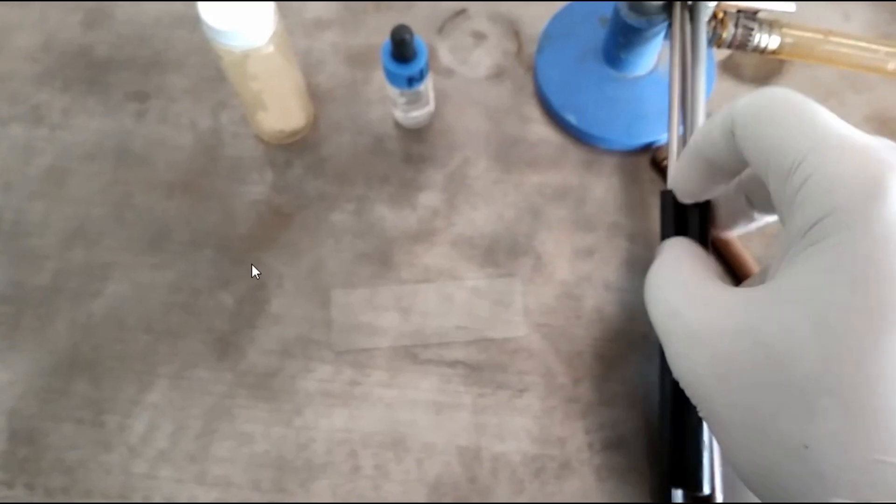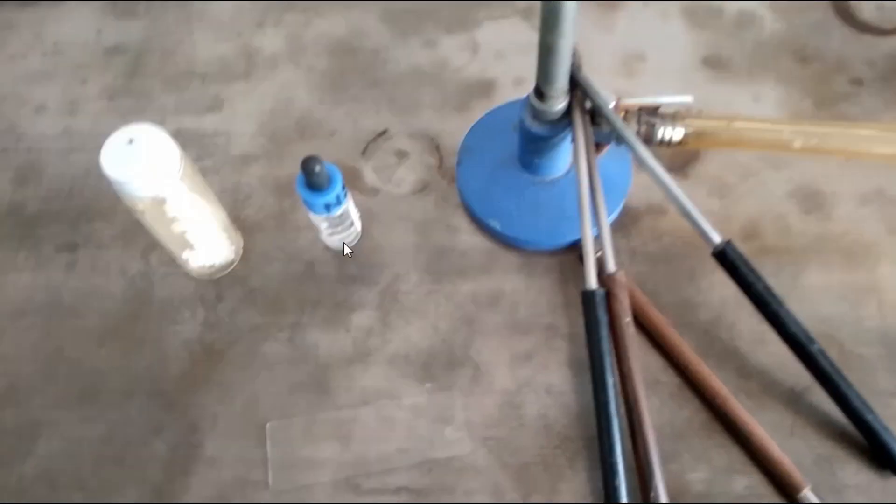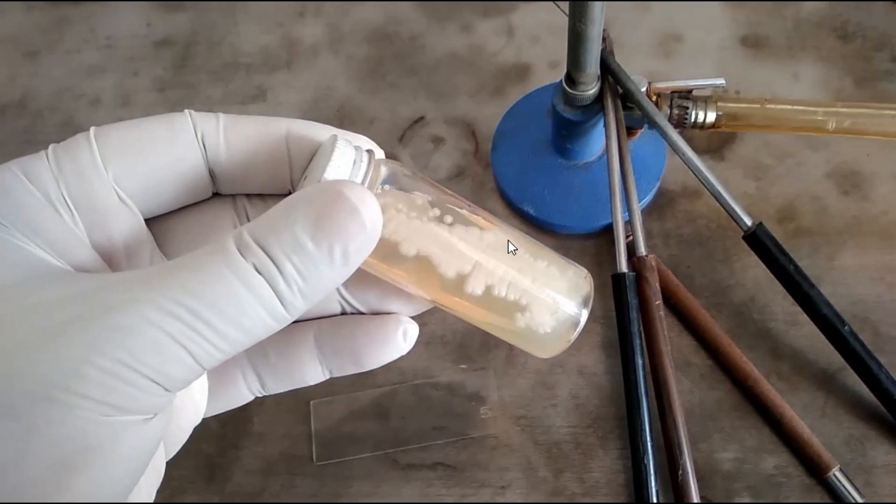Today's objective is observation of a standard slide of gram-stained Candida species. Here we have Candida growth on SDA.